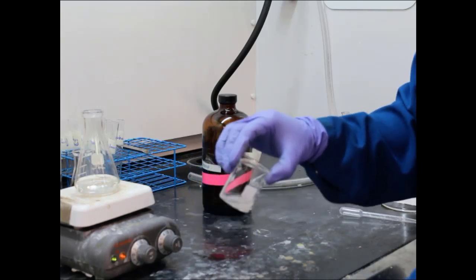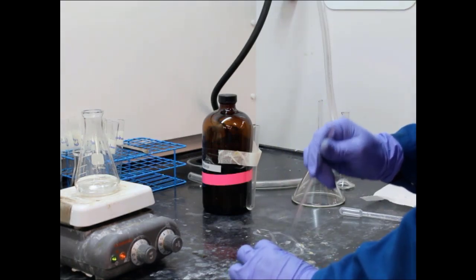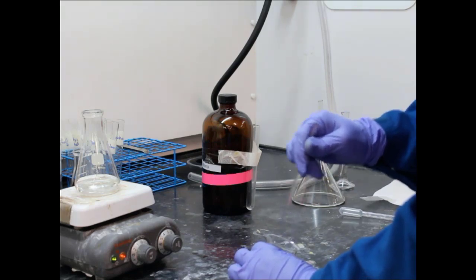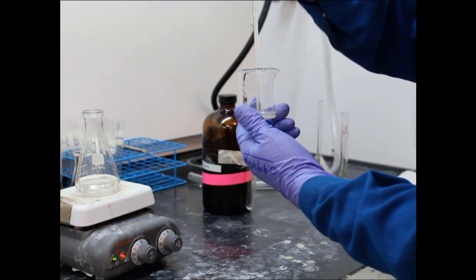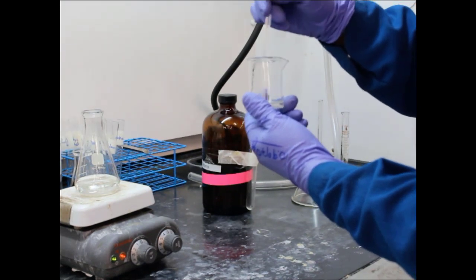Now, one thing to pay attention to here, the unknown does have some impurities in it, so not everything is going to dissolve. You'll still see some solid. But you won't see as much. Sorry, I'll throw that in there.